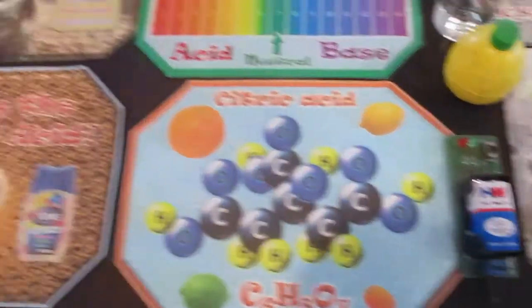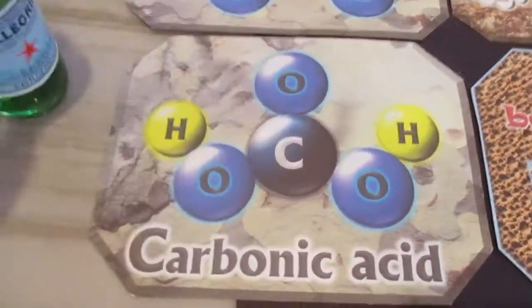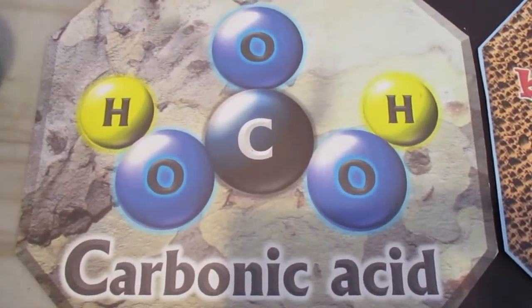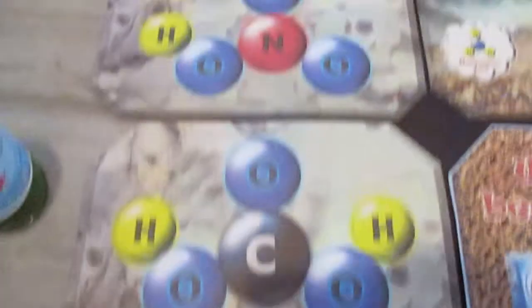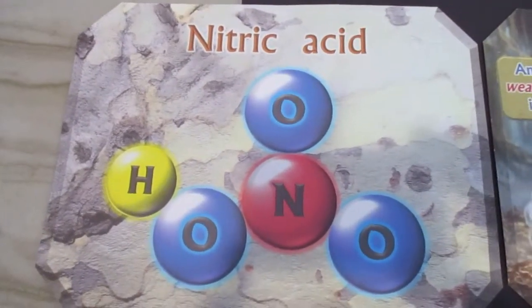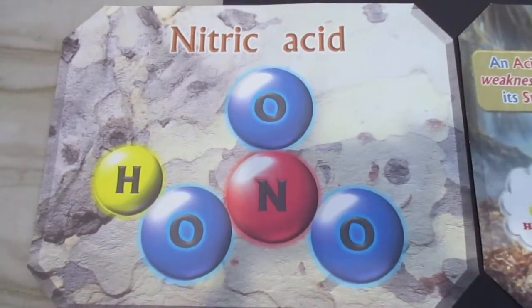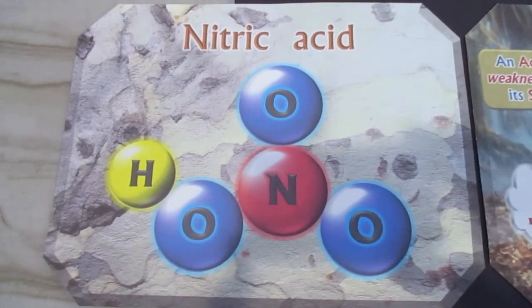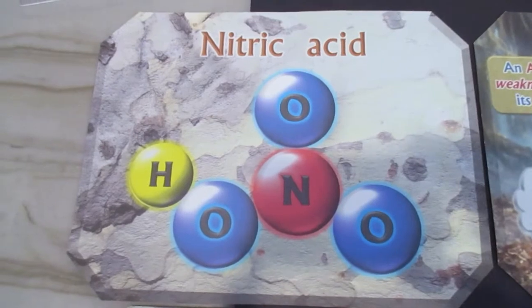Okay, and what about carbonic acid? Oh yeah, carbonic acid. I love Pellegrino. In fact, any carbonated beverage is infused with carbonic acid. That's an acid, right? So let's try carbonic acid on some things. What about nitric acid? Well, nitric acid we do not use indoors because it produces lots of hazardous pollutants. So that one you've already seen in some demos, but we're not going to be using it today.